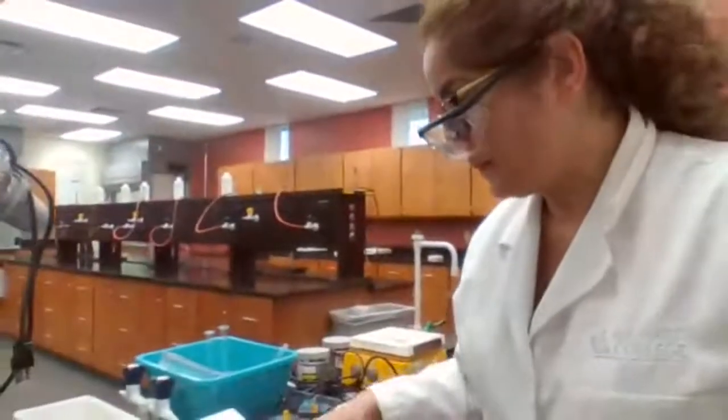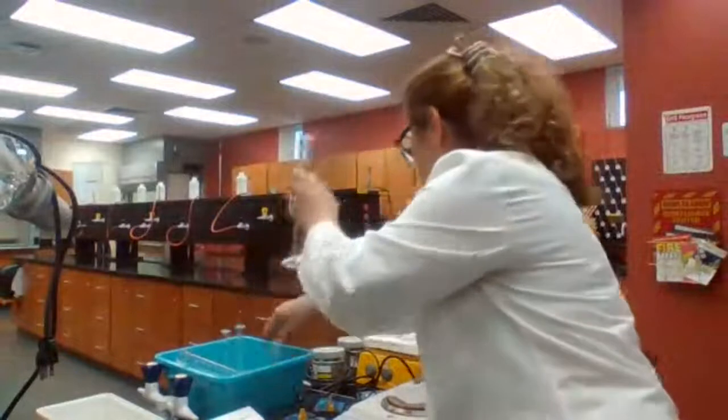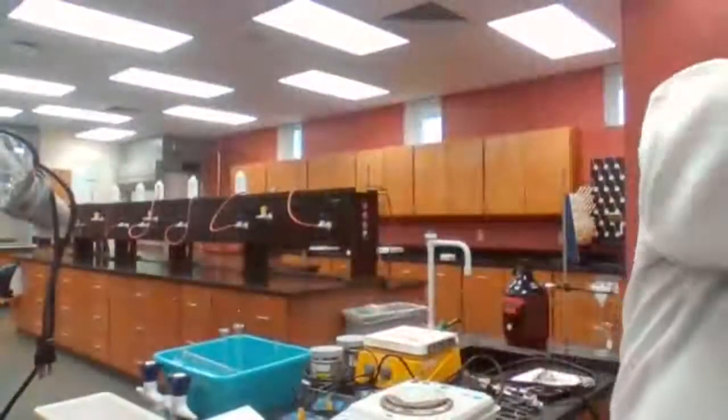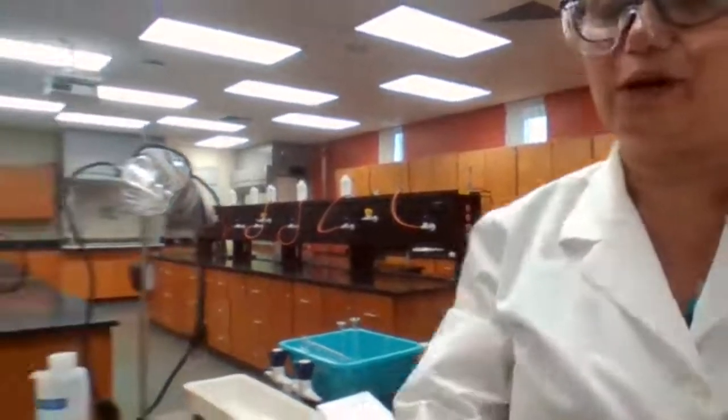Next step. What is the next step? Can you tell me what's the next step? No, you're looking at the data sheet. I want to make sure that you're not looking at the data sheet. When you are in the lab, you have the procedure.